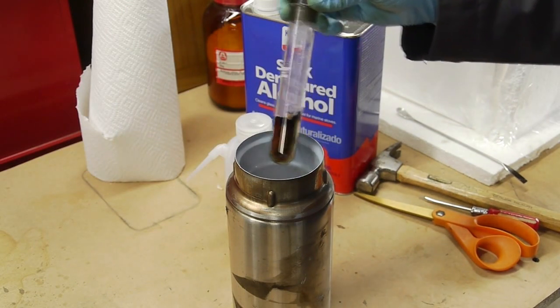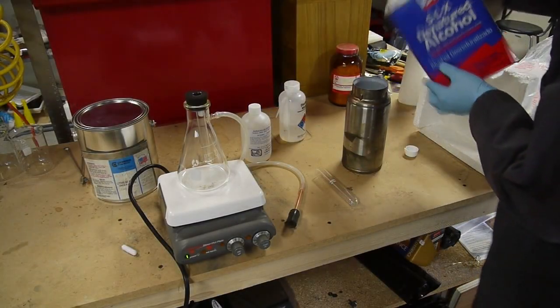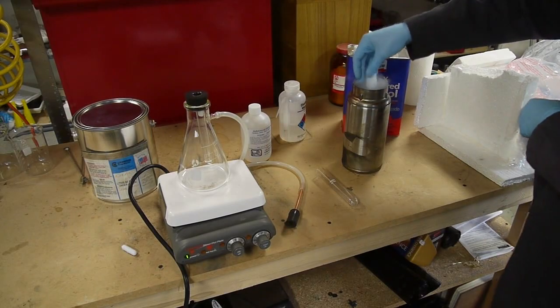So I started off by thinking what I would do is put this test tube in the thermos, and the thermos has denatured alcohol and dry ice in it to keep it cold.